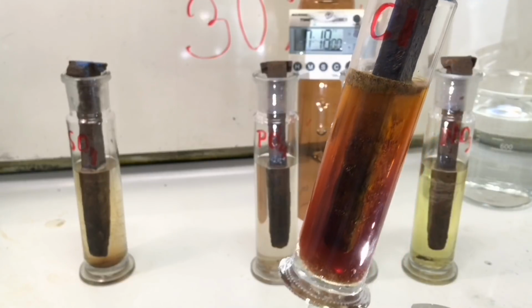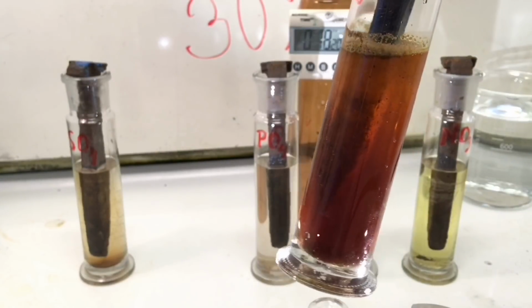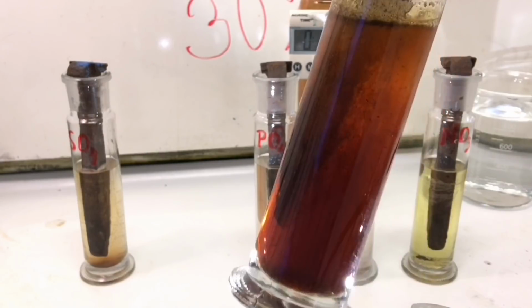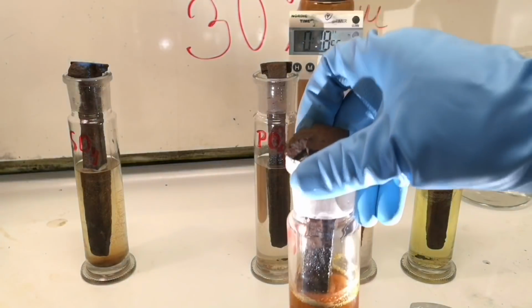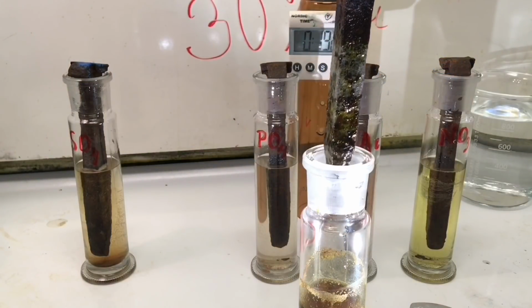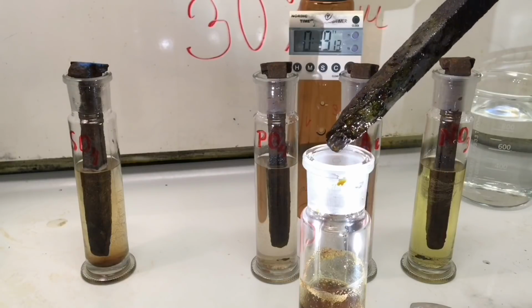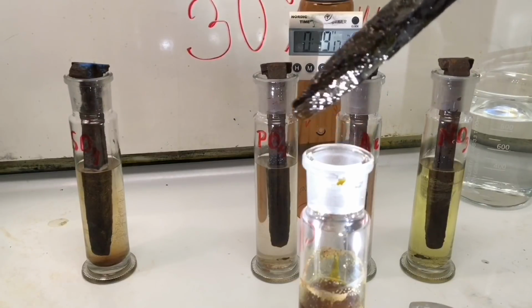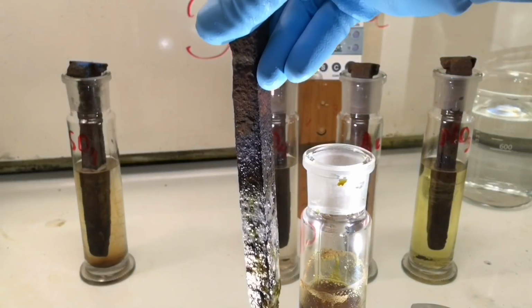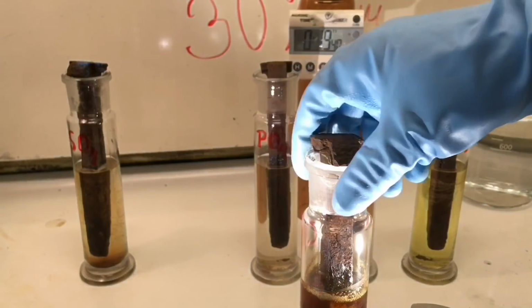And here we can see that there's a lot of progress. It's actually falling off. Flakes inside there, and it's been dissolving so much rust that you can't see through any longer. Then what you see is that basically all the rust is gone. There's some stuff sitting on the surface. What you see here, that's pure iron that we see over there. I'm going to put it back.